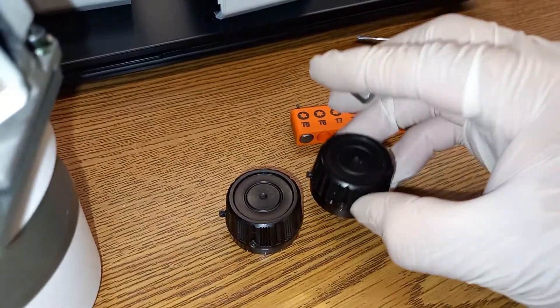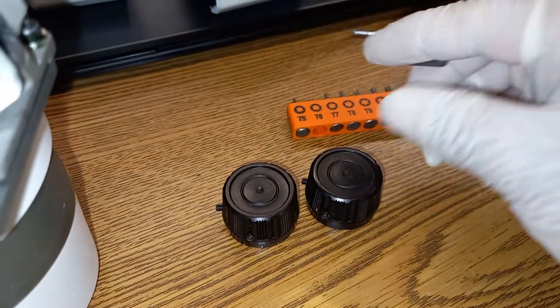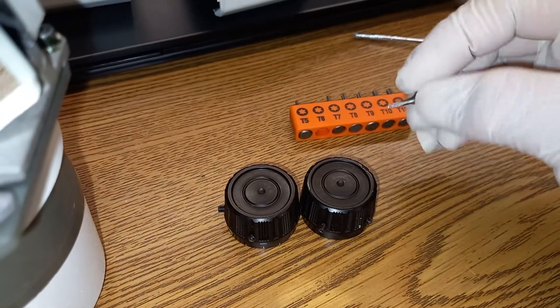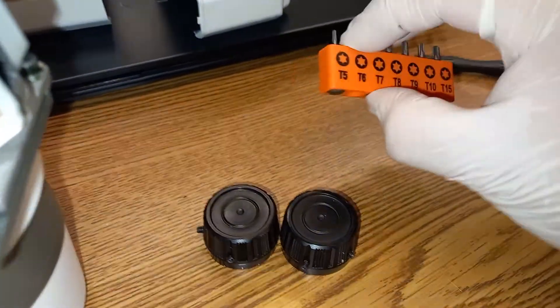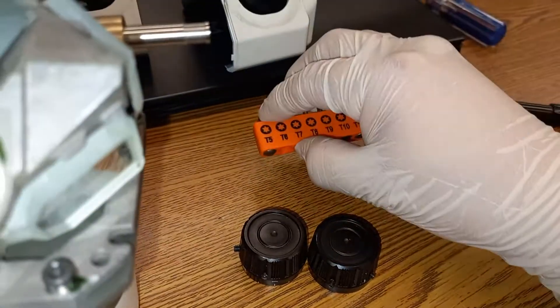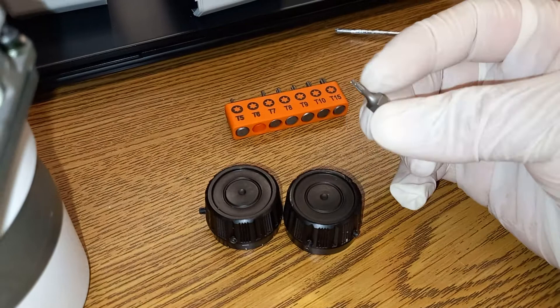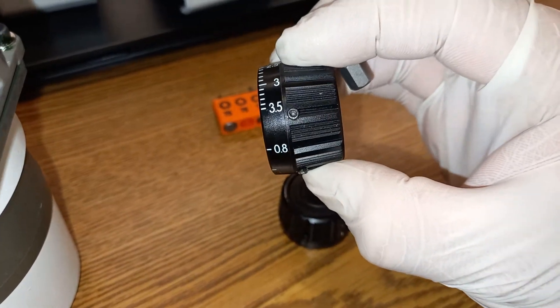It's not tightened with a machine — it doesn't have a torque wrench per se. However, it is hand-tight, so you can take it apart using just your hands. You don't need a big wrench. You can also use a hex key set — find a small one and make sure it fits into these small hex screws.